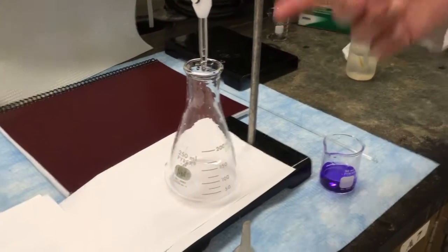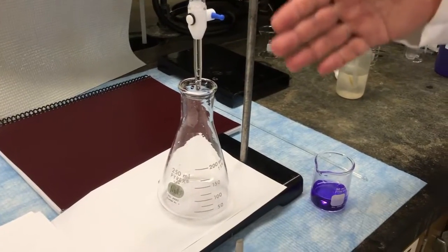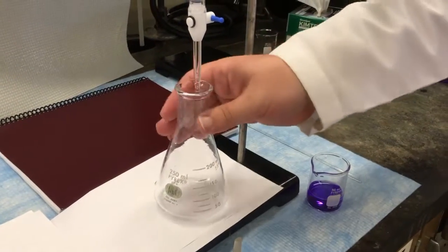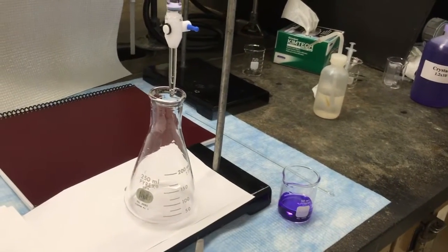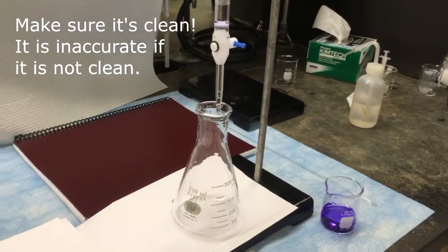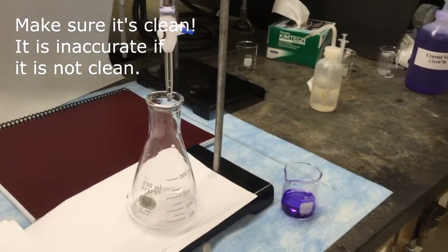By the way, you'll notice I've got a lot of residual material here. I was testing the instrument before so this isn't quite clean. That's just for the purposes of the demonstration. When you actually do an experiment in the laboratory, you want to start with clean glassware. Make sure you rinse everything carefully according to the instructions.